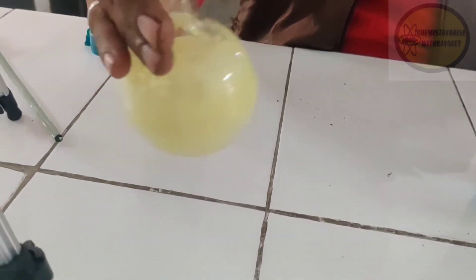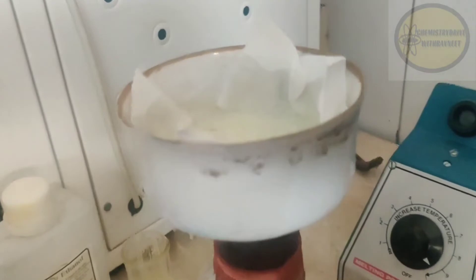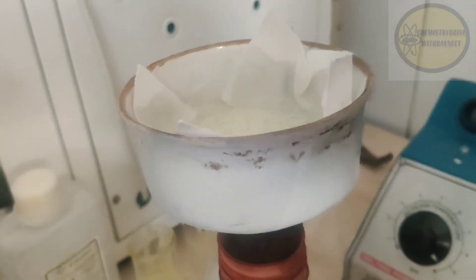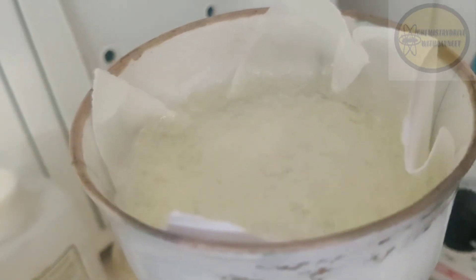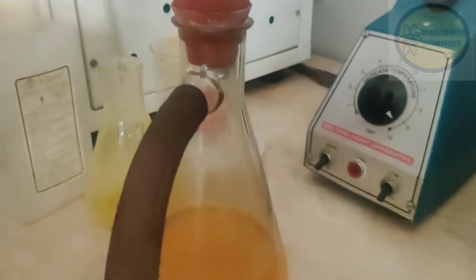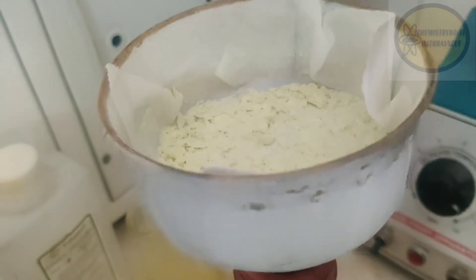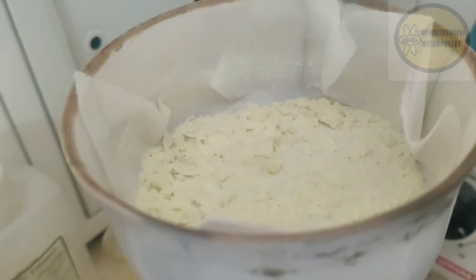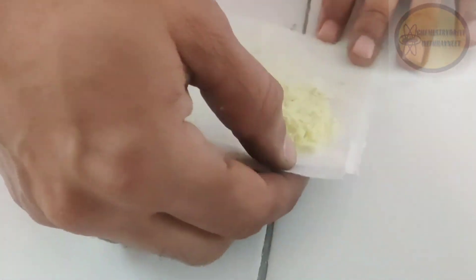As you can see in the round-bottom flask, we have the benzil. Now pour ice-cold water into this mixture with continuous stirring or shaking. Precipitates of benzil are obtained. Filter the precipitate of benzil using the aspirator vacuum pump. You can see the crystals of benzil. Wash with ice-cold water, then dry the precipitate properly between the folds of filter paper.